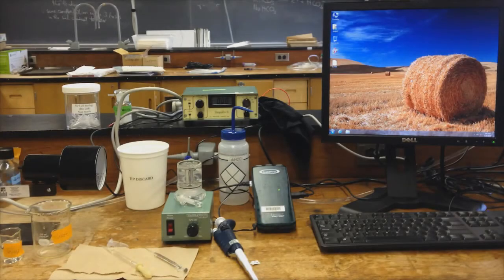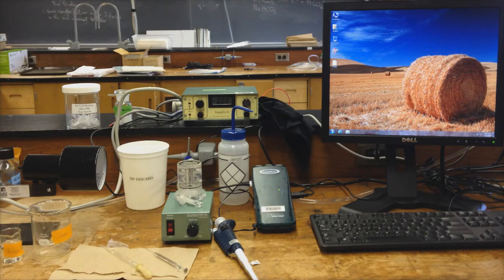In this video, I will introduce you to the equipment we are using to measure O2 exchange rates. When you arrive in the lab, your equipment will be set up roughly like this. I will not go over details of how the equipment works as this is in your lab manual. Instead, I'm going to demonstrate how you will use the equipment.